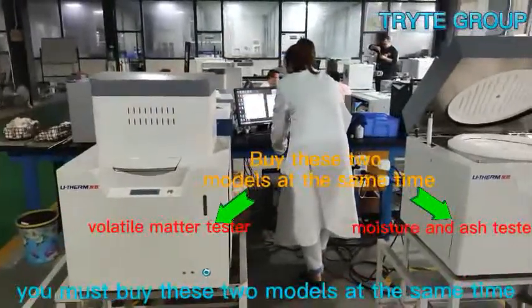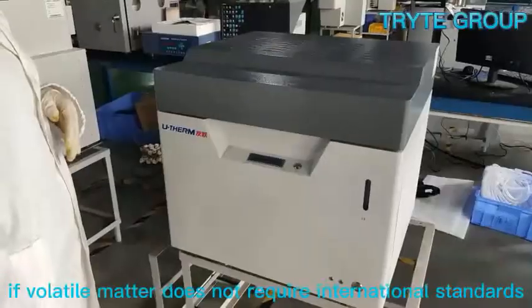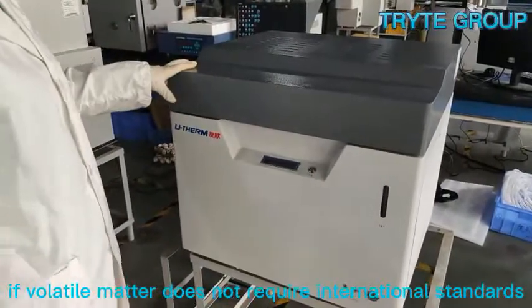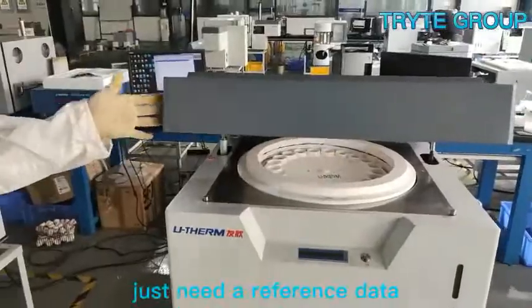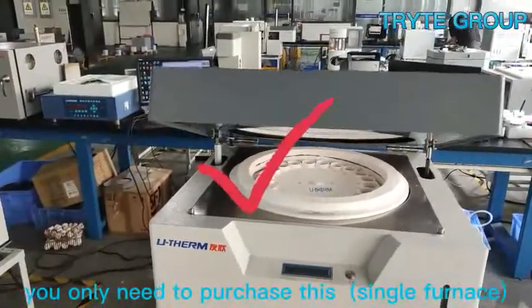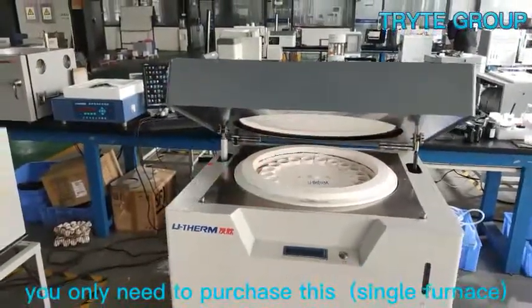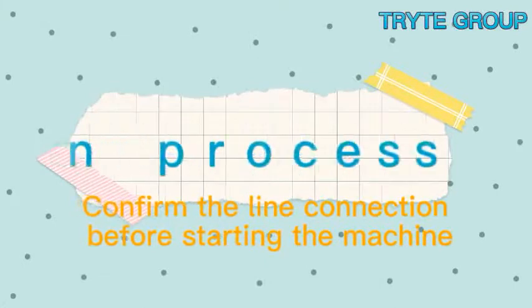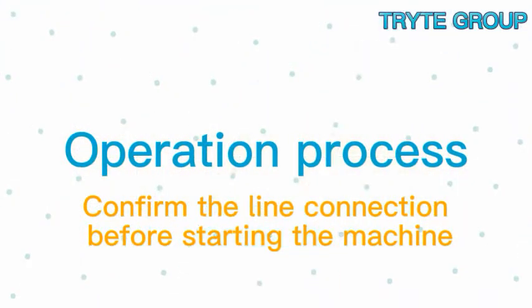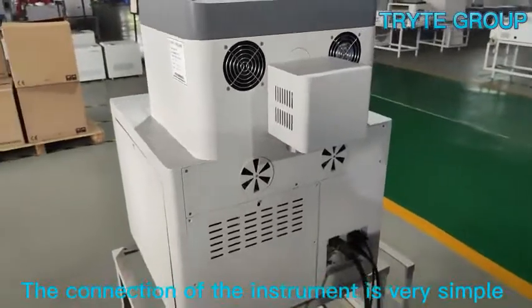If volatile matter does not require international standards and just needs reference data, then you only need to purchase the single furnace model. Confirm the line connections before starting the machine — the connection of the instruments is very simple.